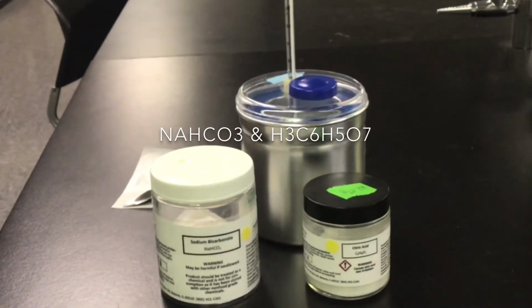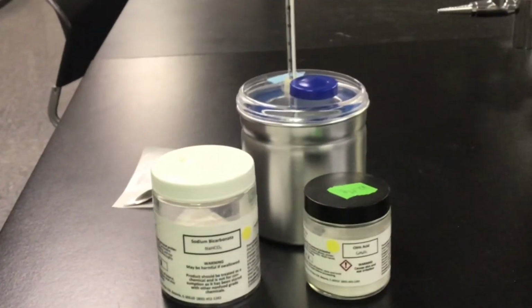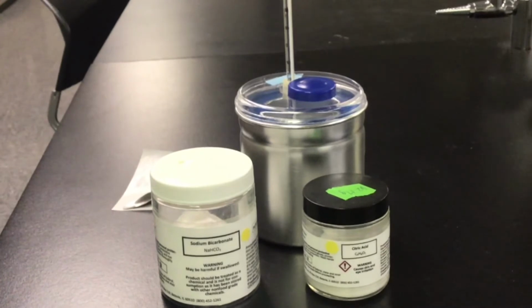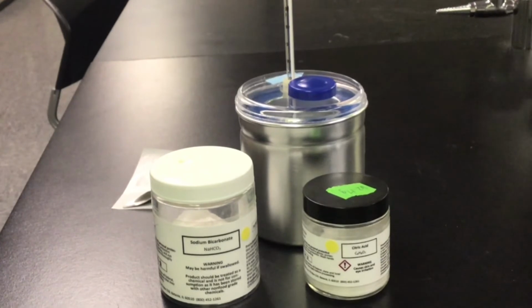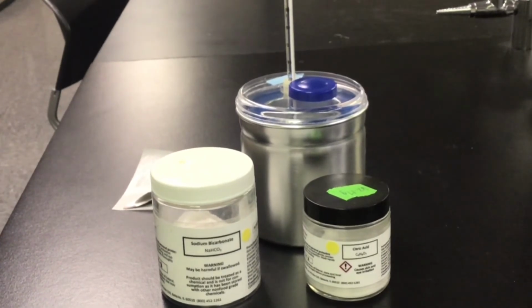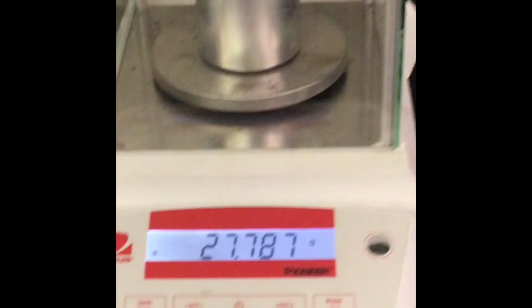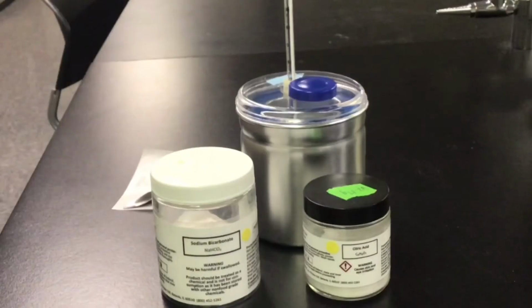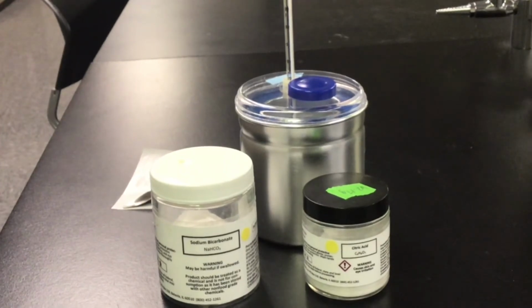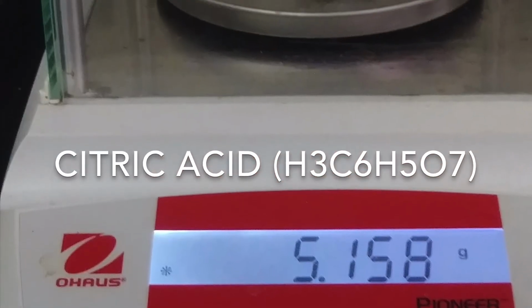Next, we will do part 2 of the acids and bases reaction. For this experiment, we will use sodium bicarbonate and citric acid and water to conduct the reaction. Again, starting with the mass of our calorimeter, please pause the video and record the mass of the calorimeter that is being used in this part of the reaction. Next, we'll measure out approximately 5 grams of the citric acid. Please pause the video and record the mass of the citric acid.